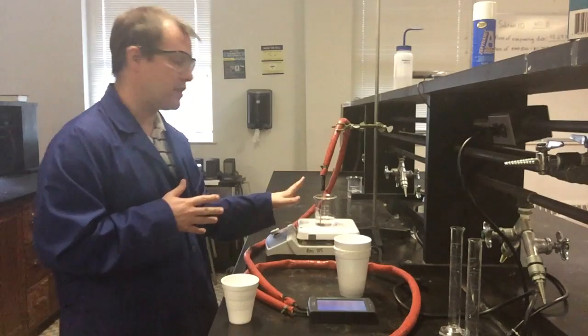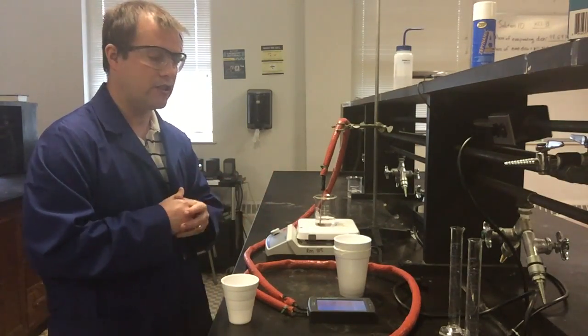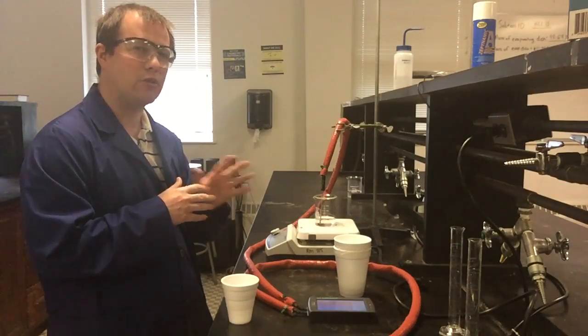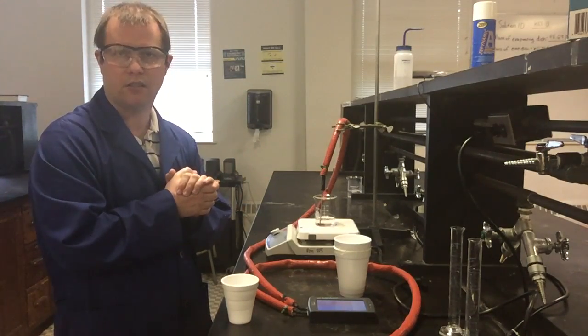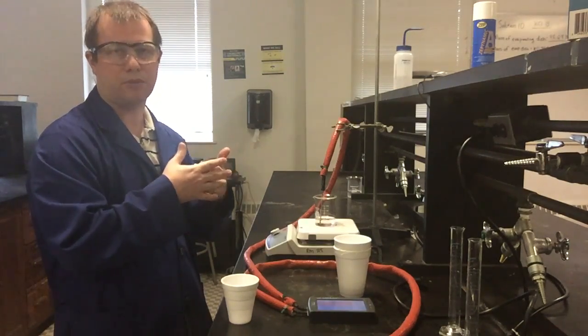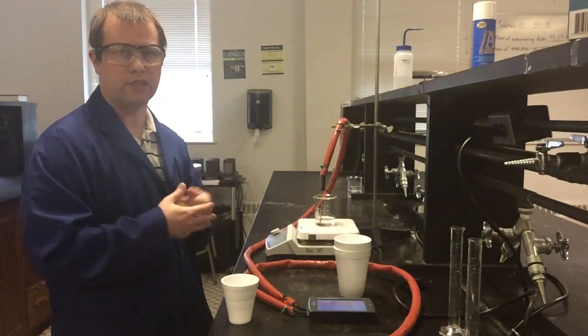I'm going to heat this hot water up to, like I said, about 40 degrees. I'll shut this off here in a second until it gets up there. Then I'm going to take it off the hot plate, let it start to cool down, keep the two solutions separate, and measure their temperature for a period of 5 minutes. Then we're going to mix the two solutions of water together and measure the temperature again for 5 more minutes. That's going to be all of the data we're really collecting in the first part of this experiment.